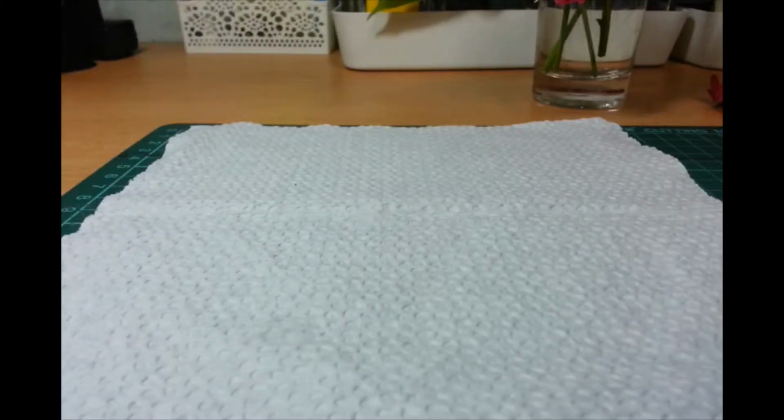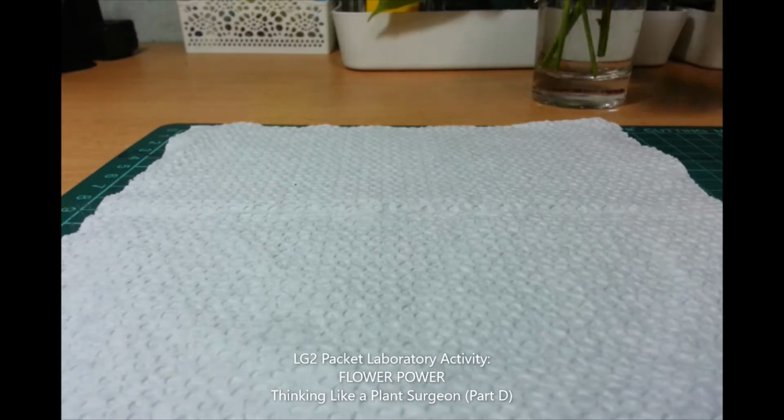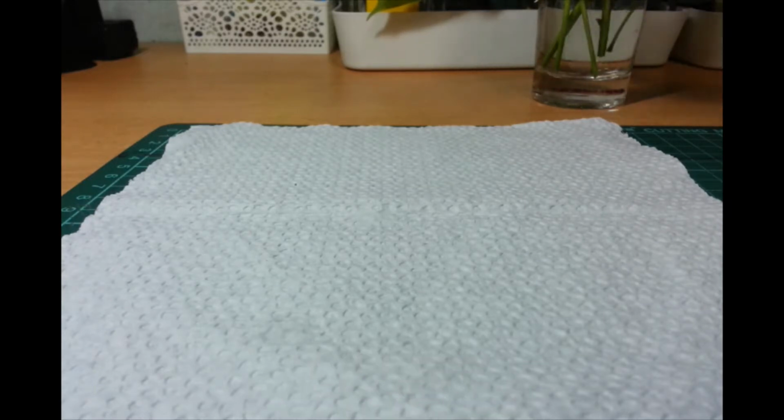Hello, Bio 2 students. I was planning a demo last week for Part D of Learning Guide 2. This is supposed to be thinking like a plant surgeon, but we replaced it with a different activity because not everybody has access to flowers and flowering plants. So I'm just going to do a demo.